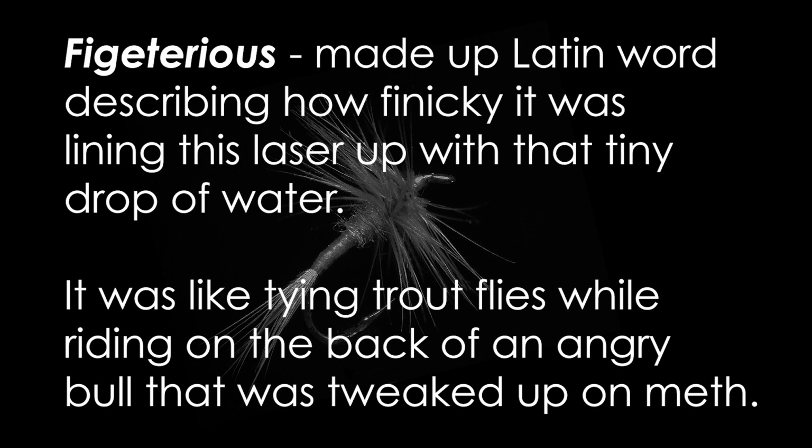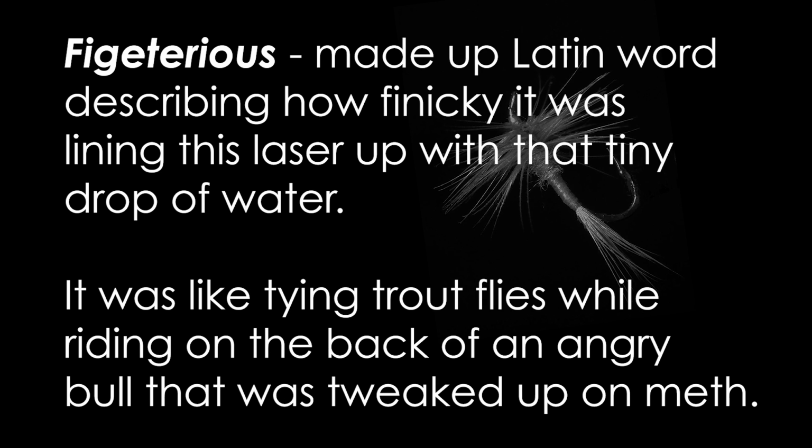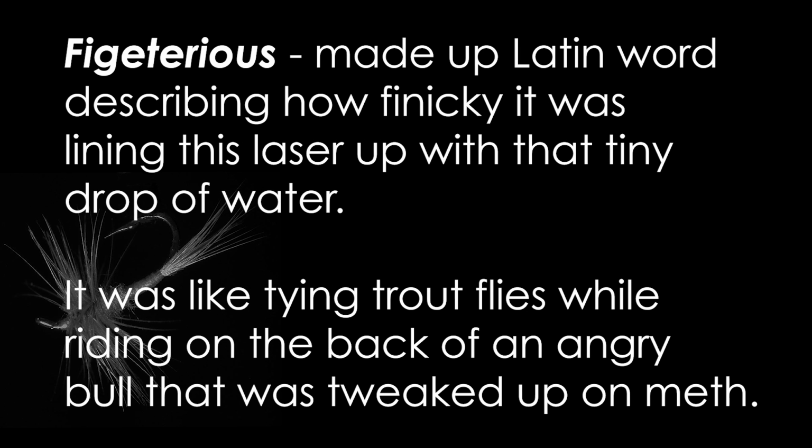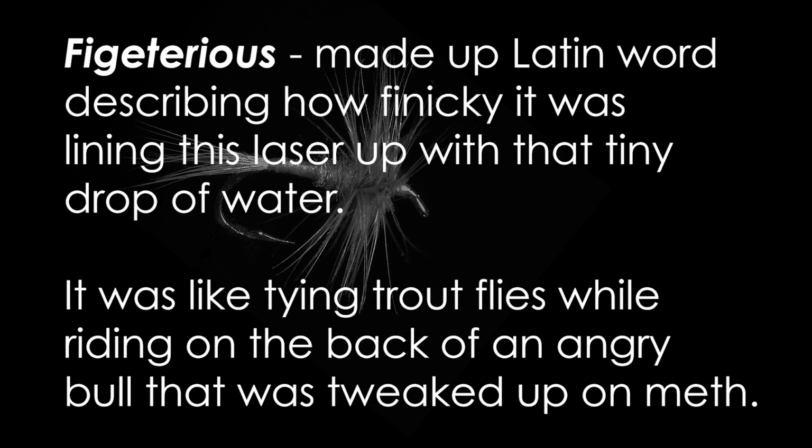Now I have a nice laser pointer, but the problem is I push the button in, and I have to keep the button pressed in for it to work. And this is very fidgety. You've got to get it lined up just right. So you want something that turns on and stays on. Next thing you need is the syringe. Here's a syringe.